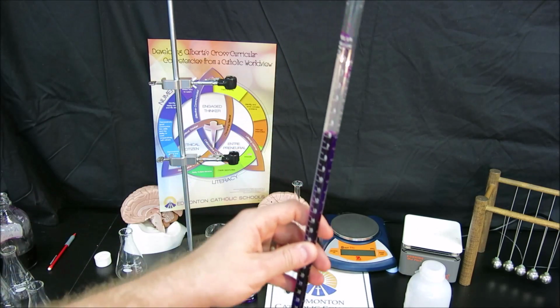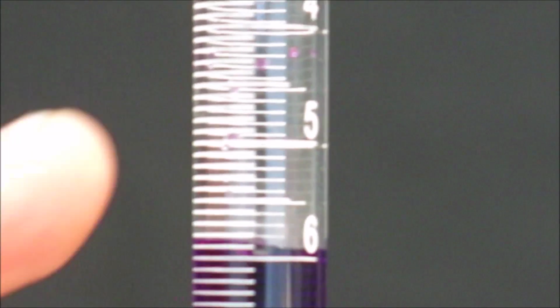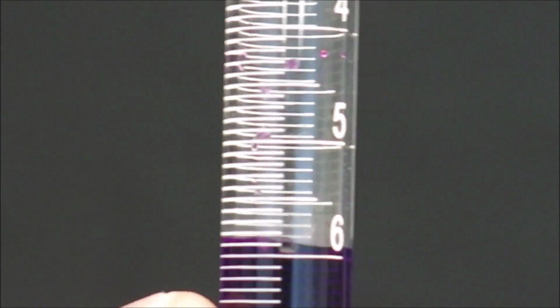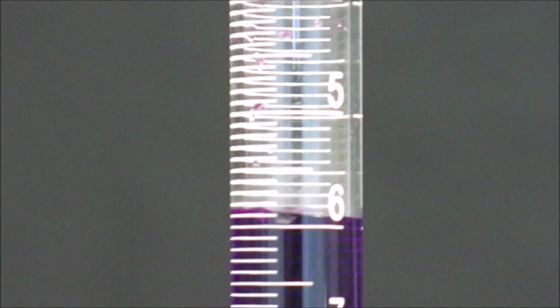In this case now, we can see the initial volume inside that burette. And when we take a look at the volume, we can see that the top of the bubble is actually at about the 5.9 mark. Now take a look, it is very important to read a burette properly. The 5 milliliter mark is up here and the 6 milliliter mark is down here. So a burette is like a graduated cylinder upside down, so the volume actually increases as you go down. The top of the bubble seems to be at this 5.9 mark, but the bottom of the meniscus, the dark spot there, is right at the 6.0 mark. And it is important to use 1 decimal point in noting volumes because this burette is set to 1 decimal point.